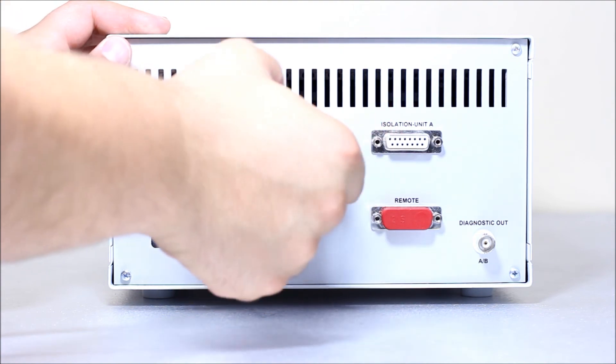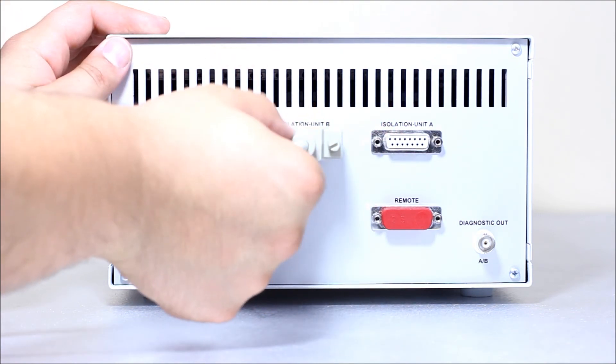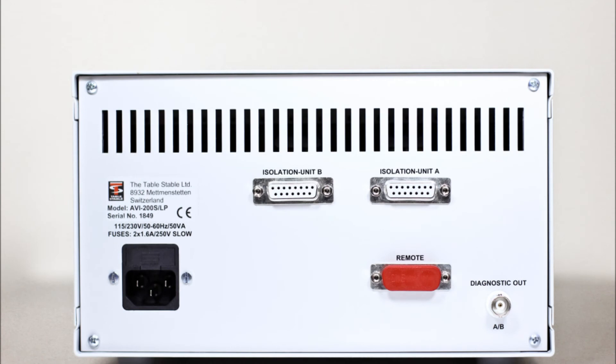Please make sure all cables have been properly connected before turning on the AVI platform. The modules and controller will be labeled to understand which connection needs to be made.